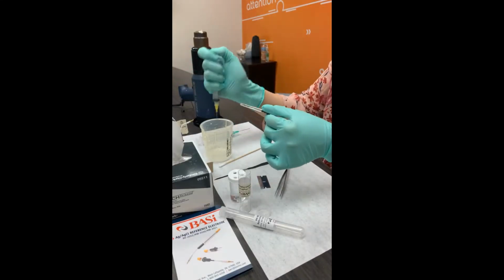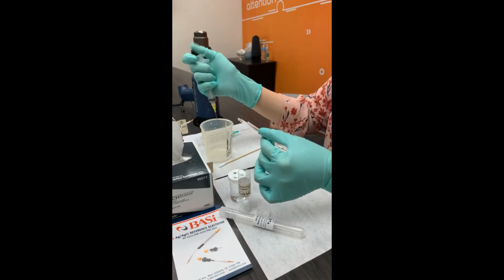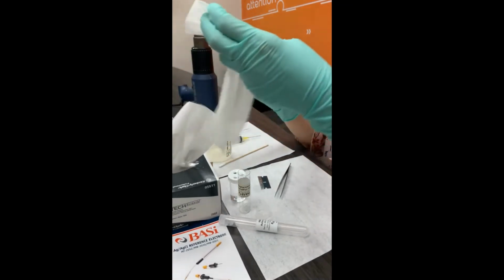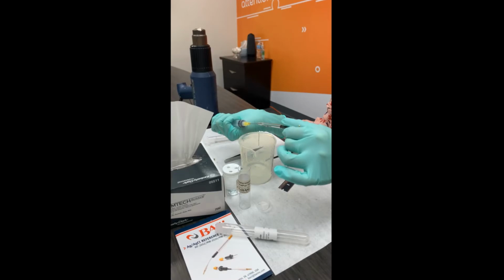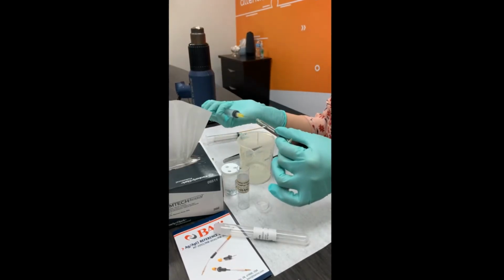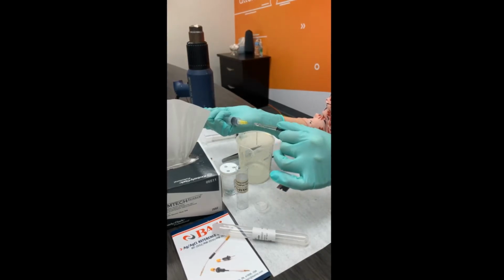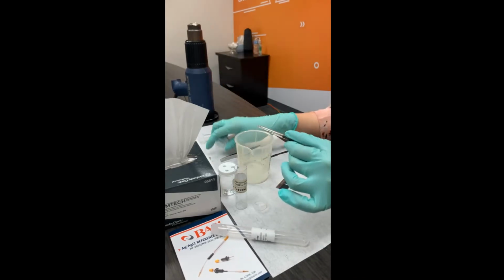Once you are done washing it and ready to refill it with your fresh solution of sodium chloride or potassium chloride, make sure that you drain it well because you don't want any leftover or excess water to potentially dilute your refill solution. And if you're unable to do that with your syringe needle, you can grab a Kimwipe and lightly tap.